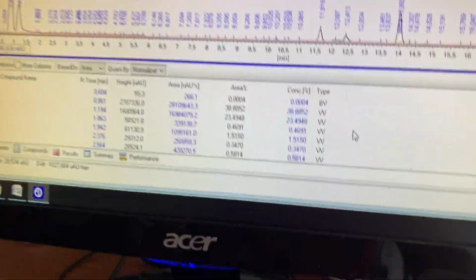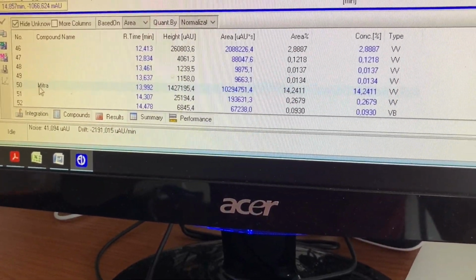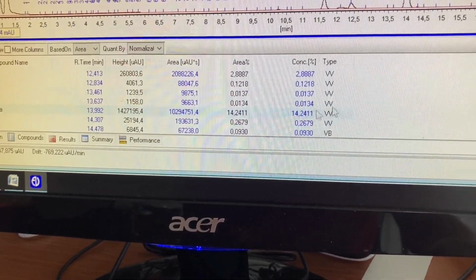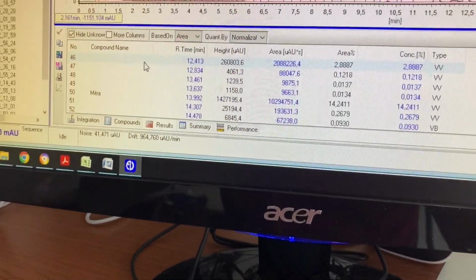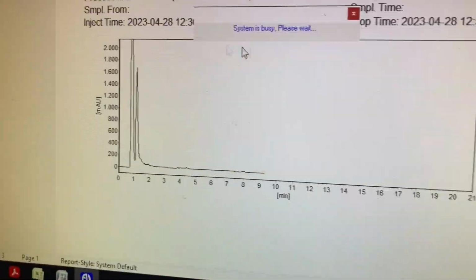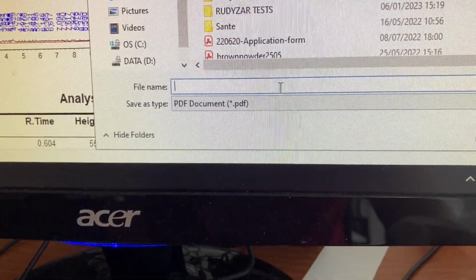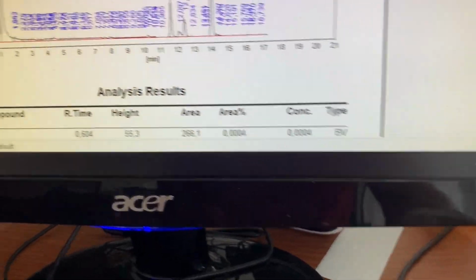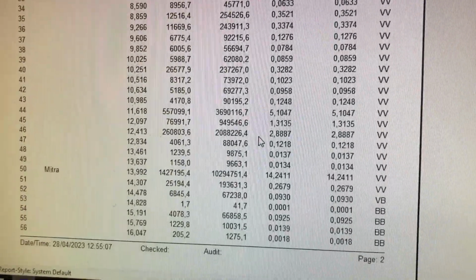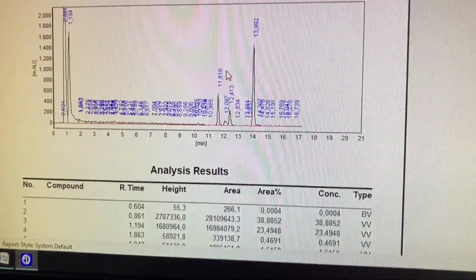And that's it. If we scroll down, it will say Mitra, which is number 50, and all the information's there, which is saved on the graph. So you can jump straight to the graph by going to print report. There it is, and you can save it on the desktop and write a name for the file, save it. I'm not going to do that this time, but there it is, the area, so you can work out exactly how much mitragynine, and in this case it's a pretty good result.